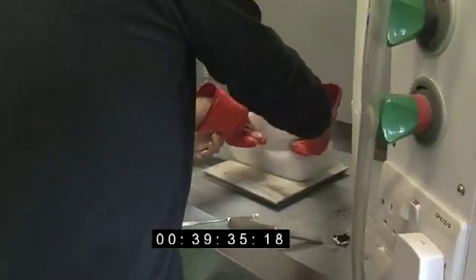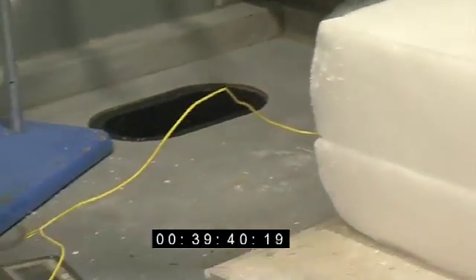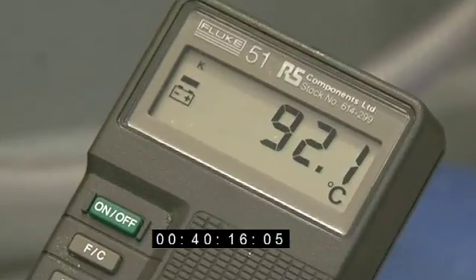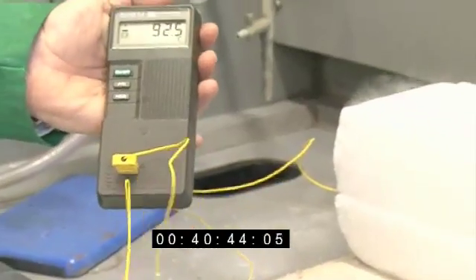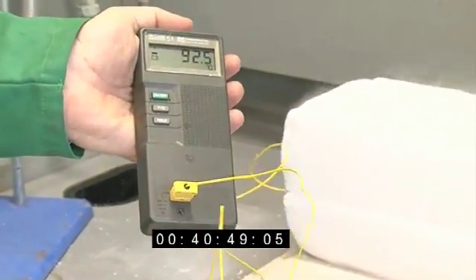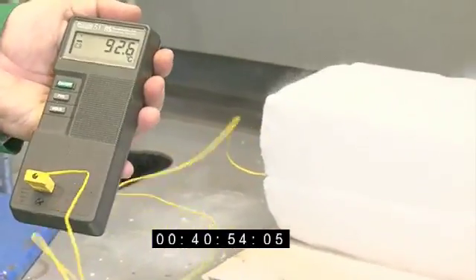We're going to measure the temperature of the dry ice, or the evaporating dry ice. We've trapped a thermocouple in between our two pieces of CO2. It reads minus 92 — so we're measuring a temperature of minus 92.5 degrees C, which is slightly different from that in the literature, probably because we're in the open lab and there may be some water vapour and other material in there.